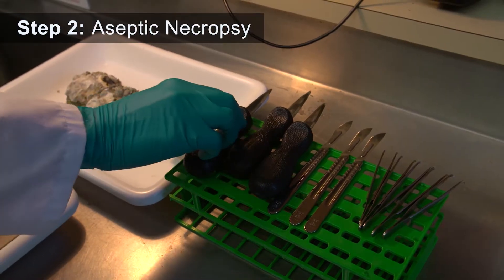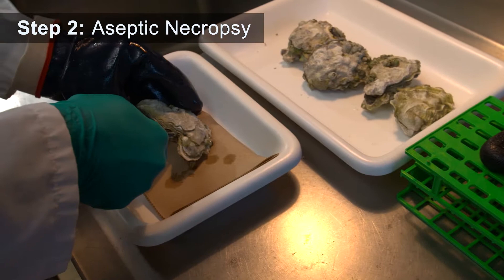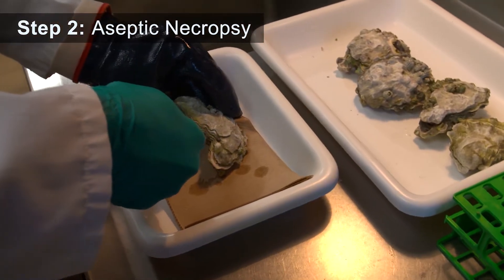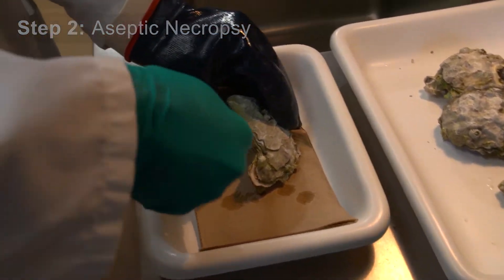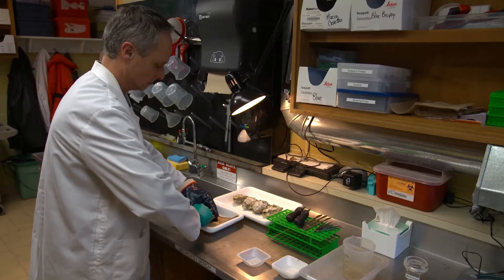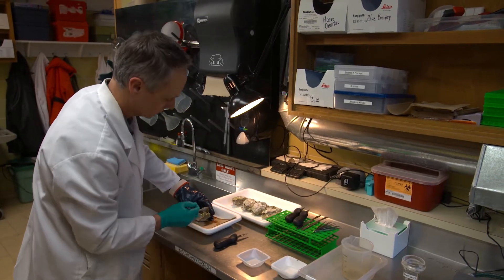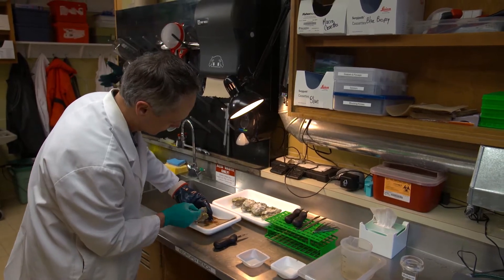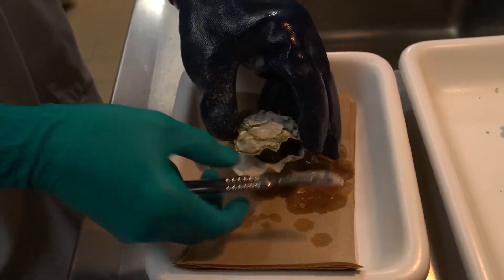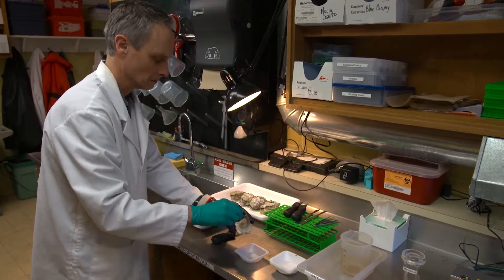In the necropsy lab, sterilized tools are used to conduct an oyster necropsy. This starts with the typical oyster shucking tool to crack open the hard shell and a scalpel to separate the oyster from its shell.